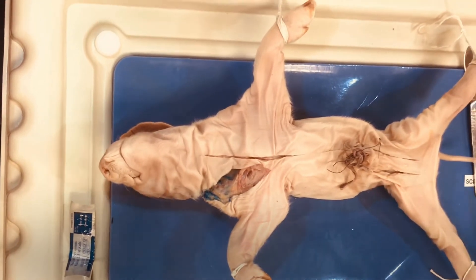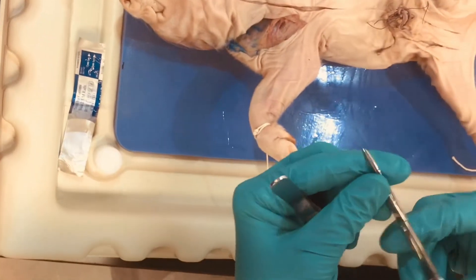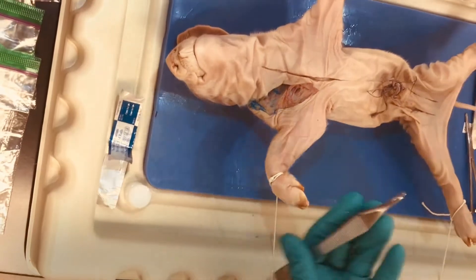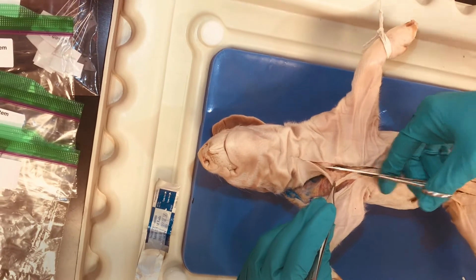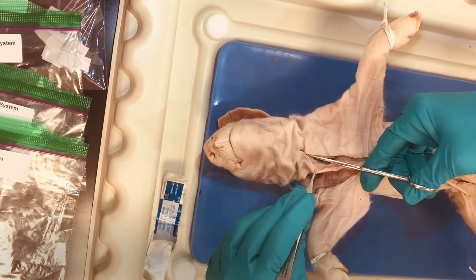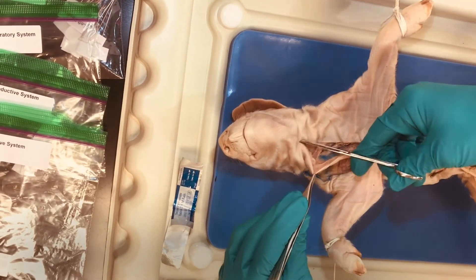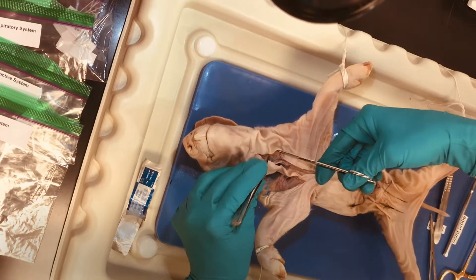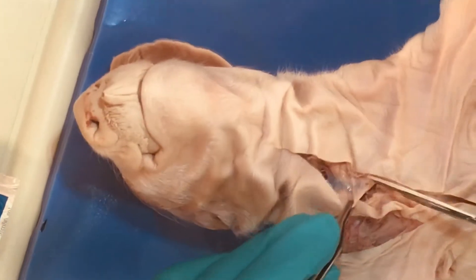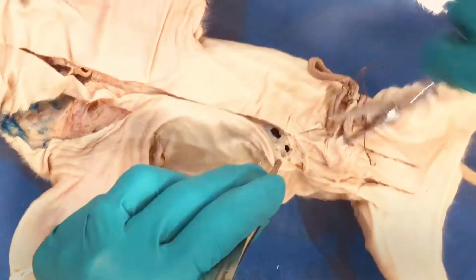The best way to get through tissue is to use scissors and forceps. These are Brown-Adson forceps — you can see the teeth right there. These are utility scissors, not ideal for tissue, but for dissection purposes this is acceptable. What I'm going to do is open my scissors up, extend them in and open them up, separating this tissue away from the deep tissue. This way I protect my deeper structures and can extend my incision cranially. Moving down, I'm going to lift this tissue up and cut, doing this all along my incision, and at the abdomen as well — lifting up and making little cuts so I don't cut through my organs.